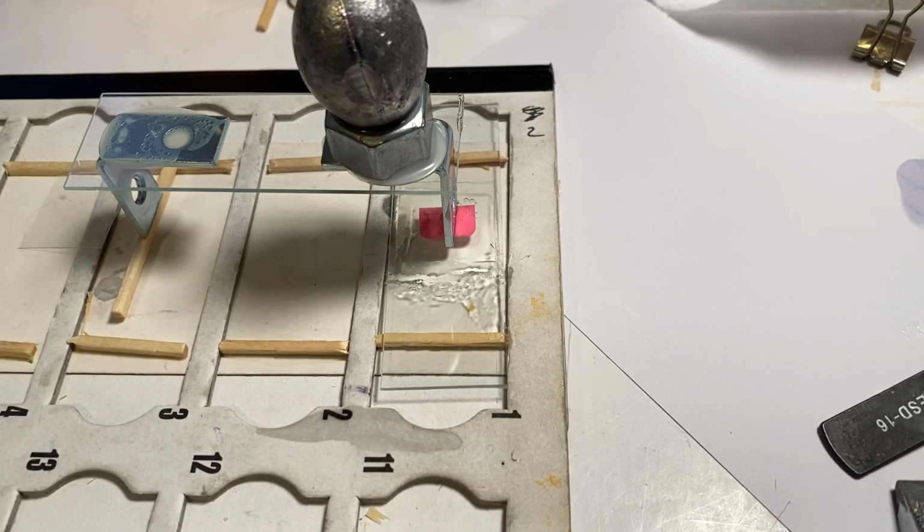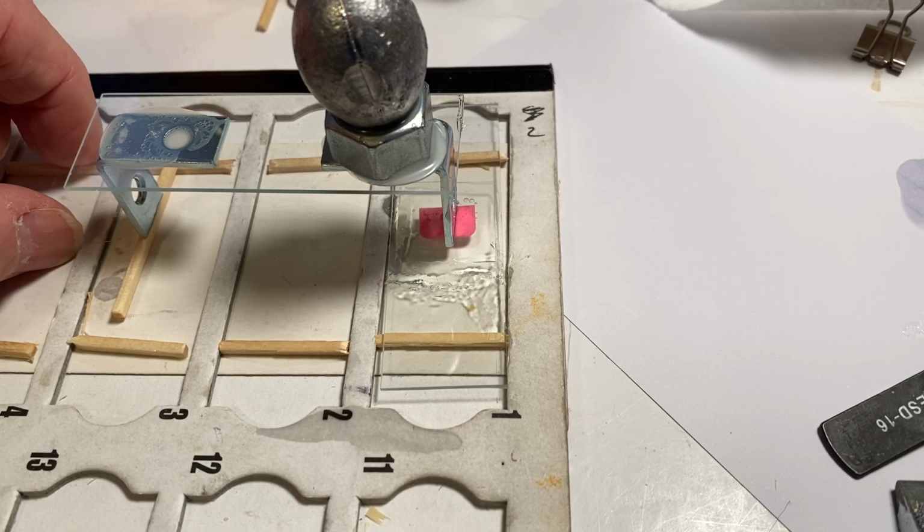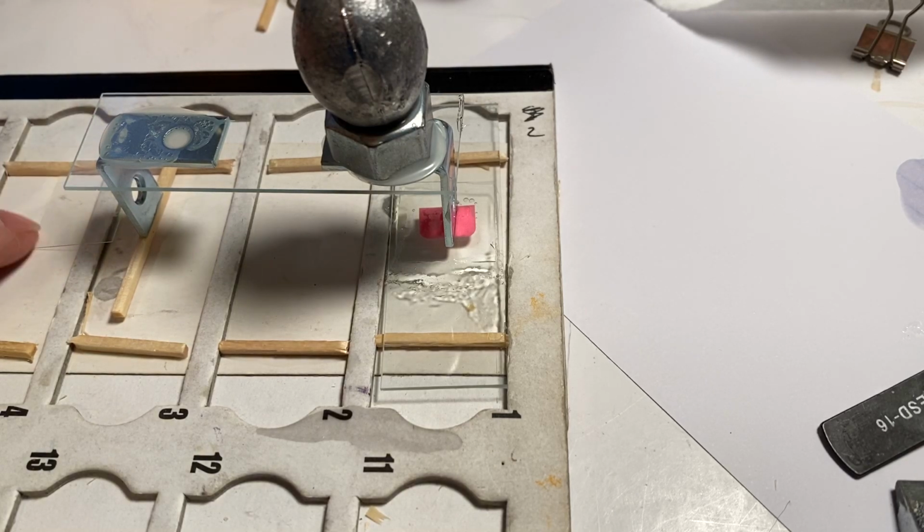Then you leave it like that for as long as it takes. Could be a few days. It could be a week. Could be 2 weeks. The thicker the slide, the longer the dry time. That's all I can say.